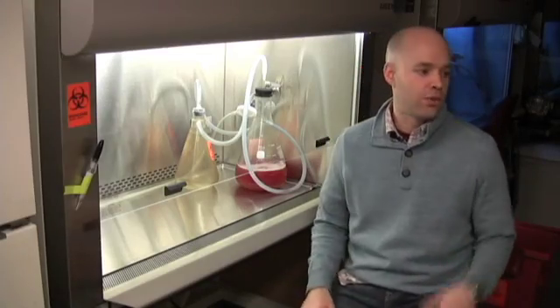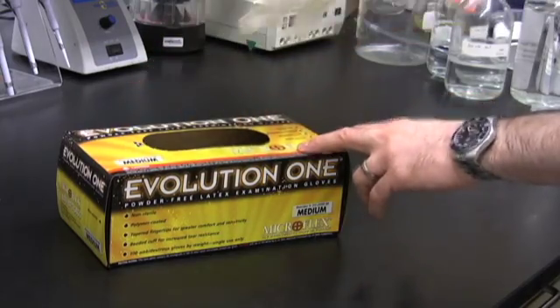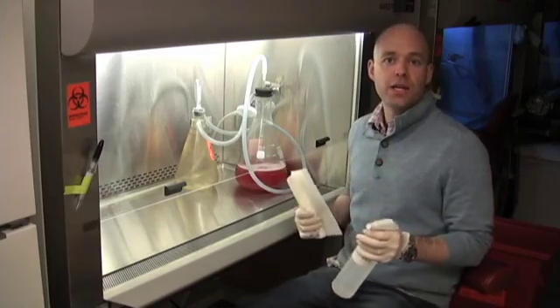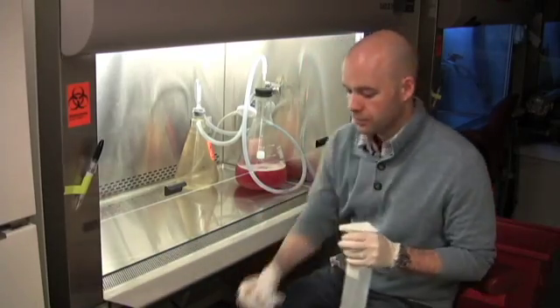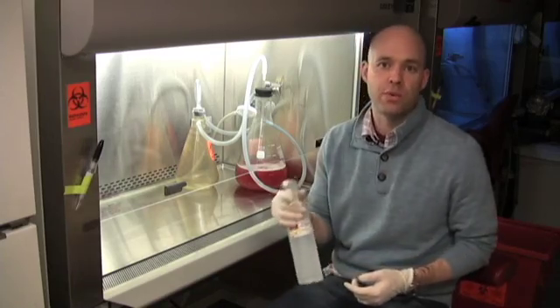So the first thing you want to do is grab a pair of gloves. Before you get anything in the hood you want to spray it down liberally with ethanol and wipe down. So from now on anything that goes into the hood will always be sprayed with ethanol.